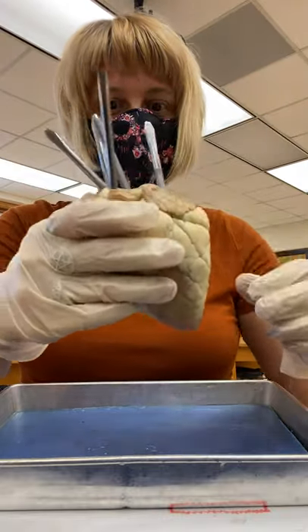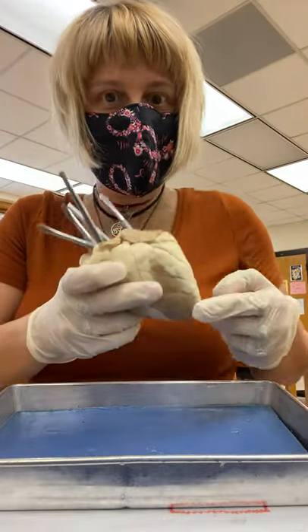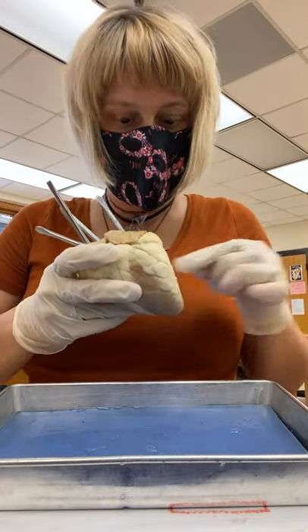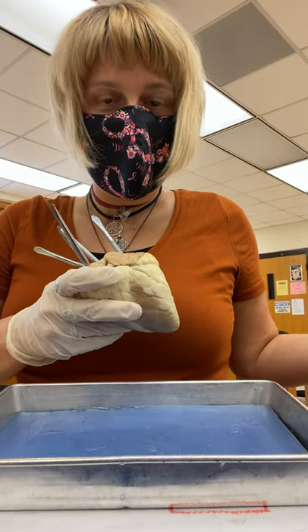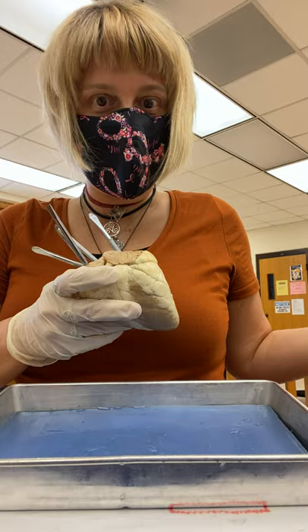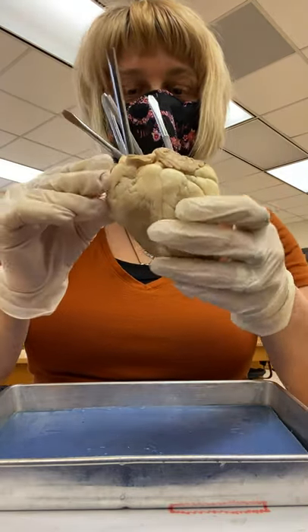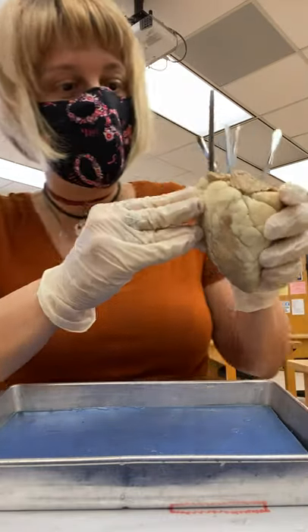If we look, you can see the apex is going to be towards my left hand, so this heart should be like this, right? Apex facing the patient's left hand. And so this is the apex, and this is the superior portion of the heart.